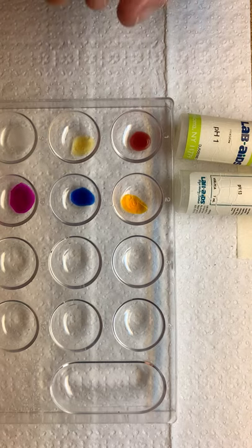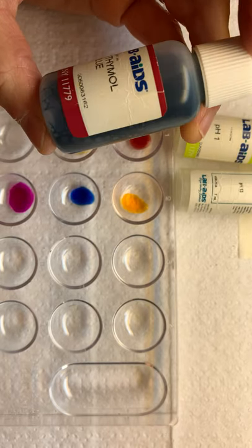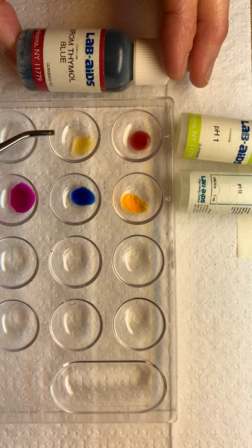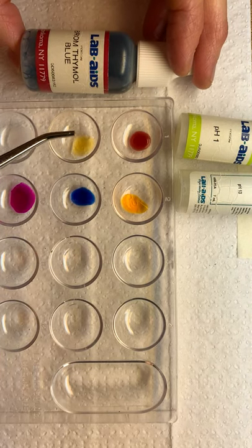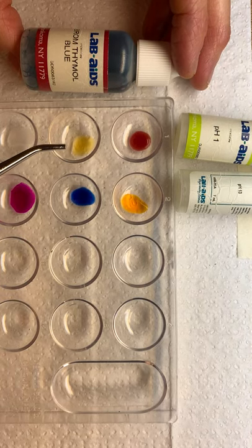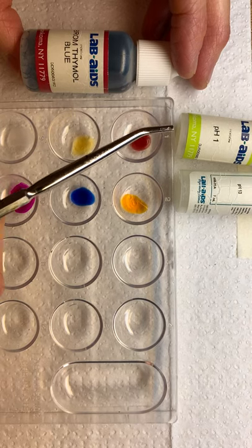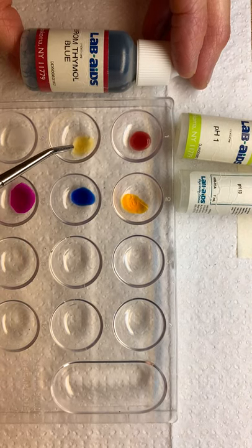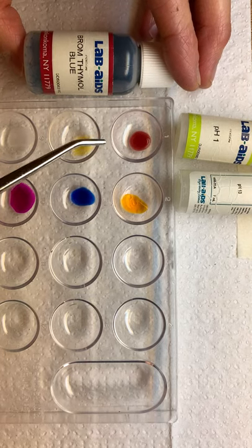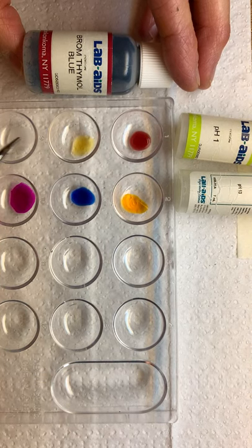Number four: bromthymol blue is what color? Well, it tells you in the title — bromthymol blue is blue. Remember we added bromthymol blue to this row. Number five: bromthymol blue changes to what color in the presence of pH 1? It changed to yellow. So bromthymol blue changed to yellow in the presence of pH 1, and pH 1 is an acid.